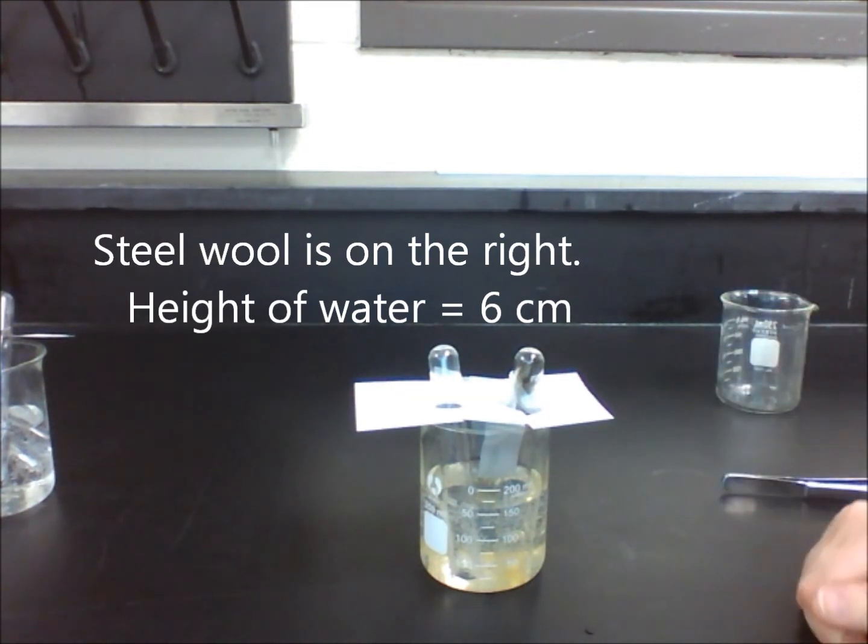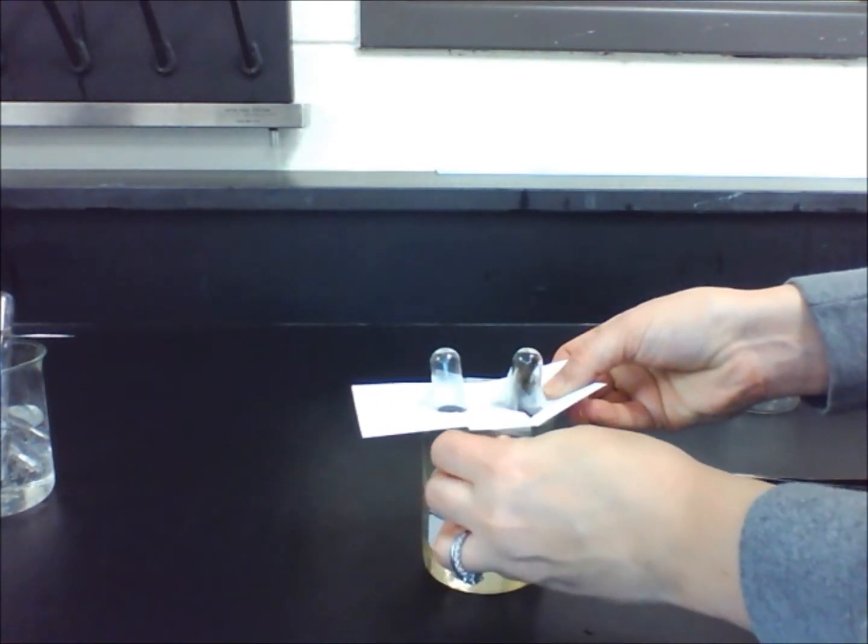While watching, you should notice that the water is rising up the tube and the steel wool is starting to turn brown or orange.